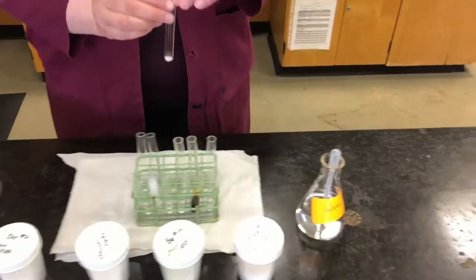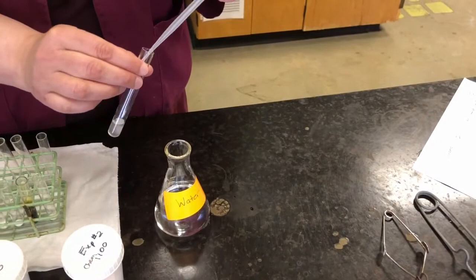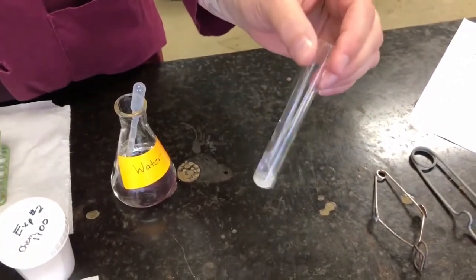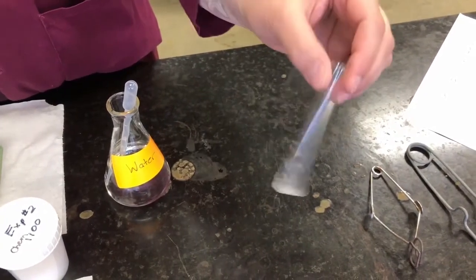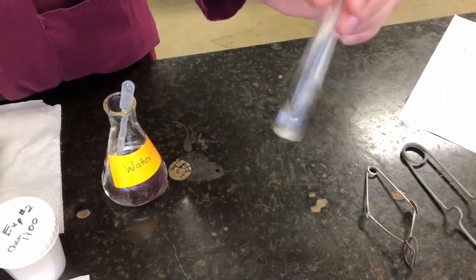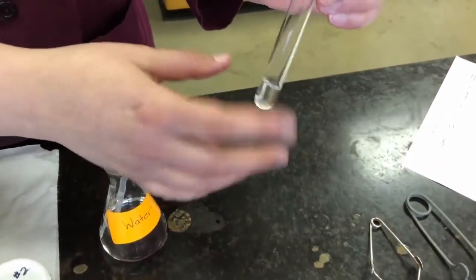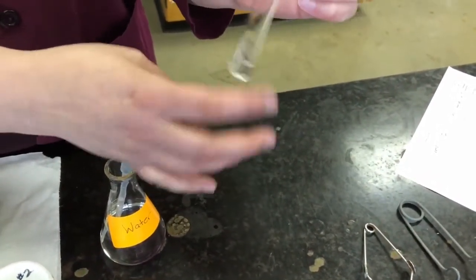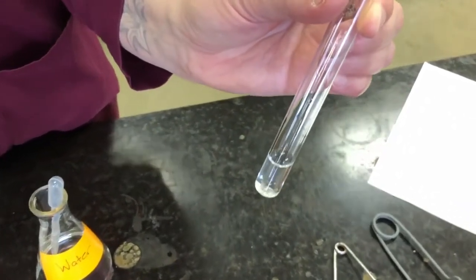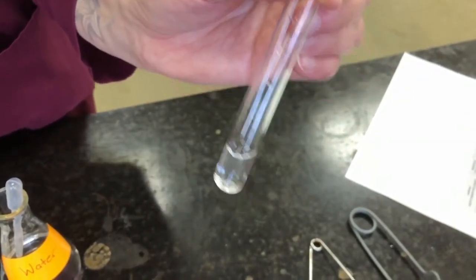Our next sample is Epsom salts. Add some water. Let's see if it dissolves. So I shake it. A little bit stuck to the bottom. And there we go. Sometimes to shake a test tube, you just kind of flick it on the bottom with your finger. It creates a little vortex in there. Helps it to dissolve. Then you can see that, yes, Epsom salts is also soluble in water.